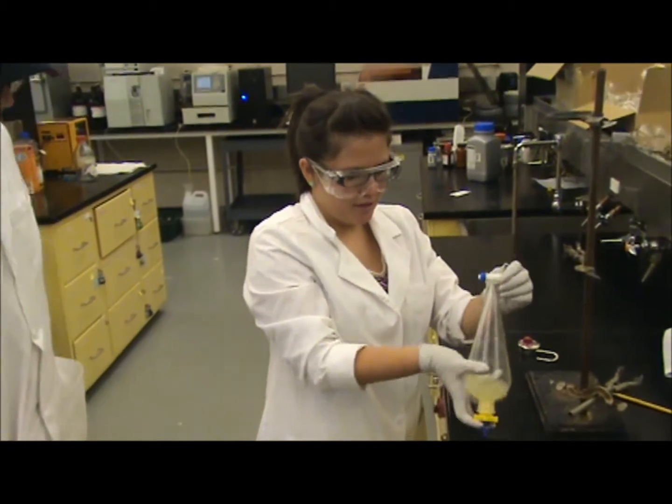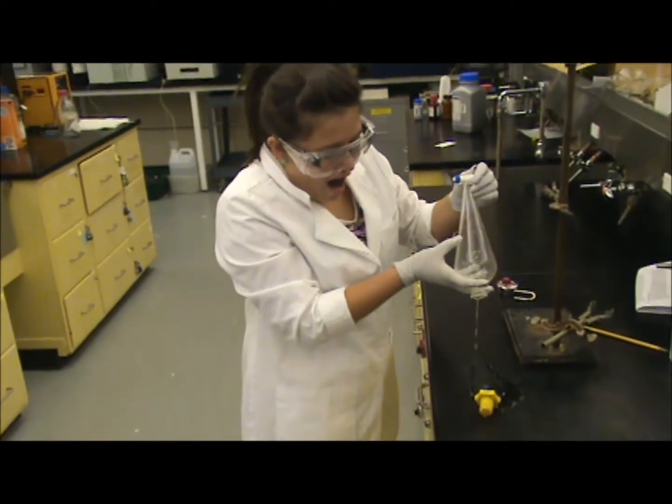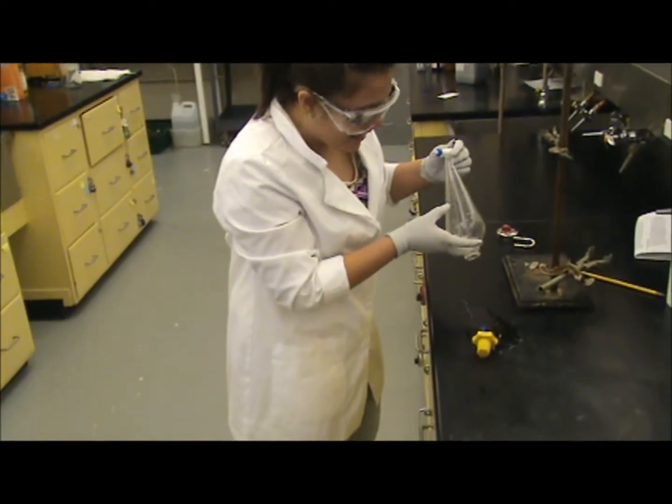Good luck. Thank you. I don't want that at home. Oh, my gosh! That's our product!